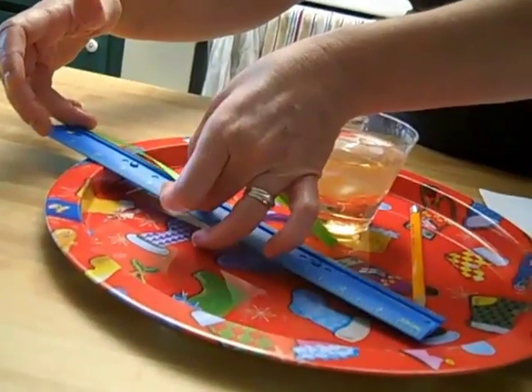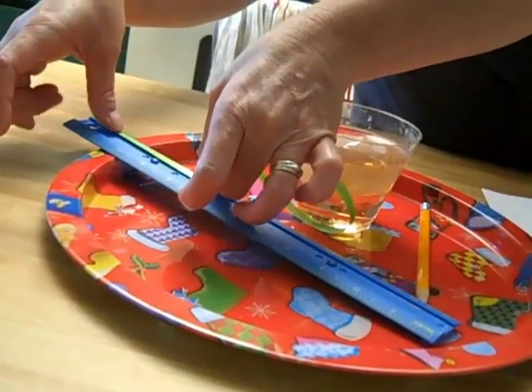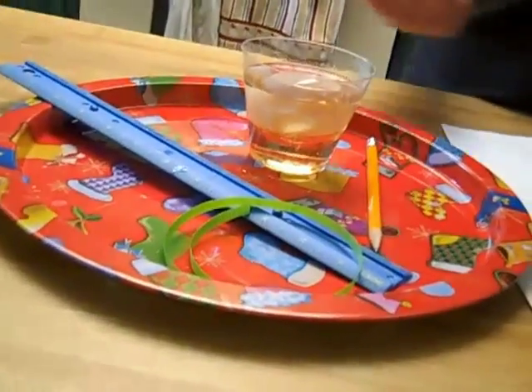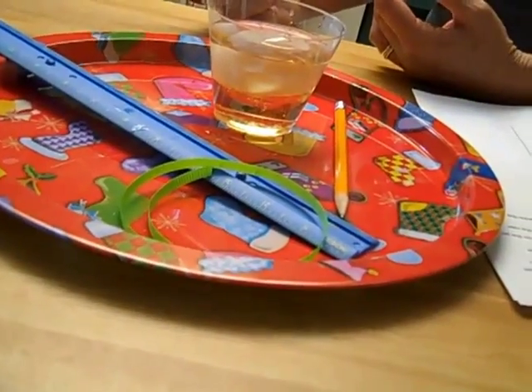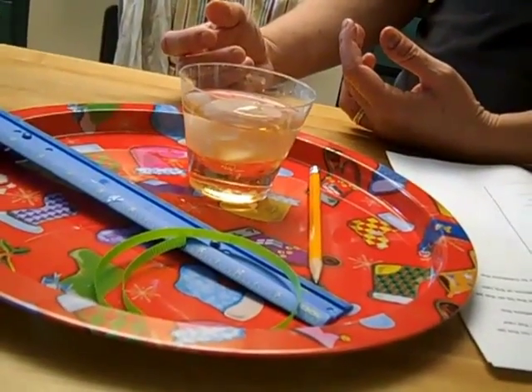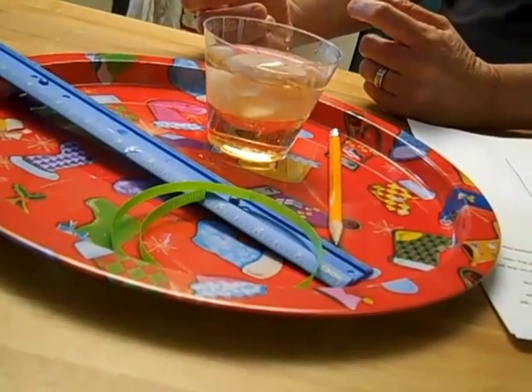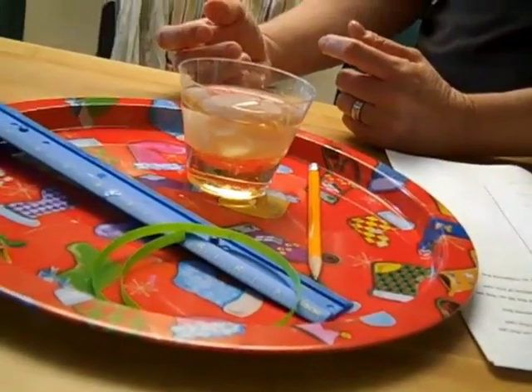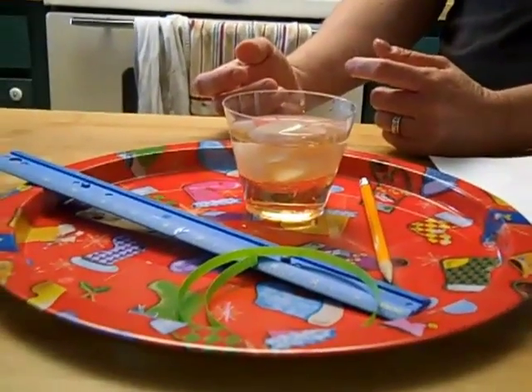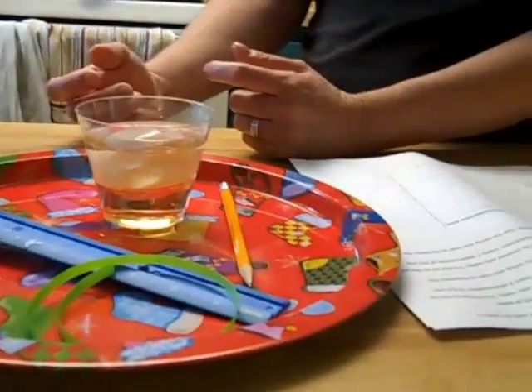We are down to 12 centimeters. Let's make sure that's correct — 12 centimeters. So we went from 17 centimeters to 12 centimeters. That is the end of our experiment. You should be able to draw conclusions from that. Remember how plump the egg was — think about that when you think about a plant cell, and how that plant cell might plump up the same way, as you answer that question about how this would affect plant cells as well.